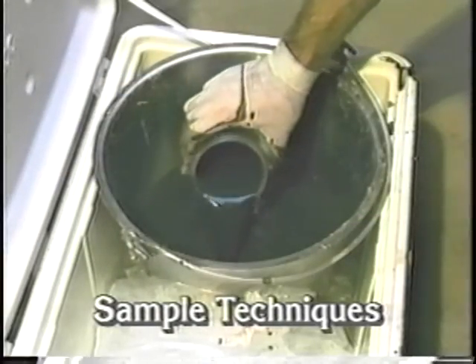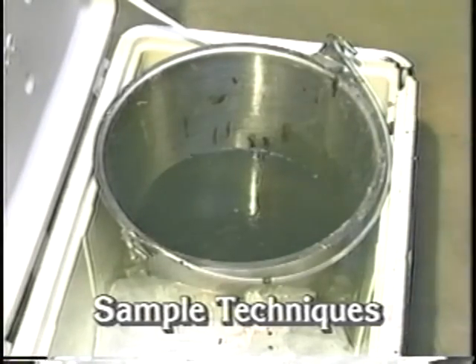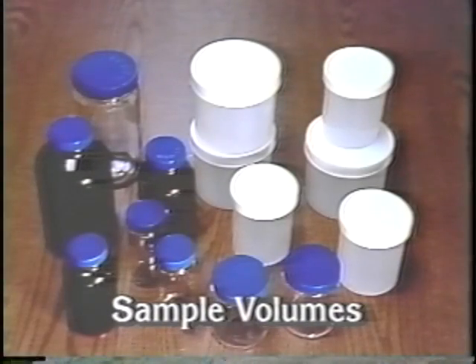Identify the sample collection techniques, either grab or composite, needed to get a statistically representative sample. The amount of sample required depends on the solids content of the sludge and the detection limit of the analytical technique. Check with your lab and make sure you collect more than enough sludge for analysis. Typically, sludge sample volumes range from 8 ounces to a quart, or 250 milliliters to 1 liter.